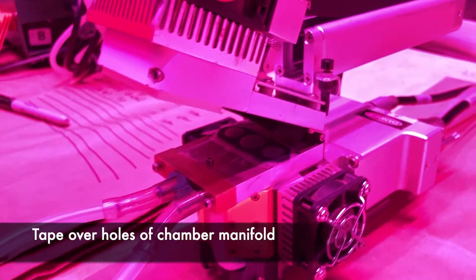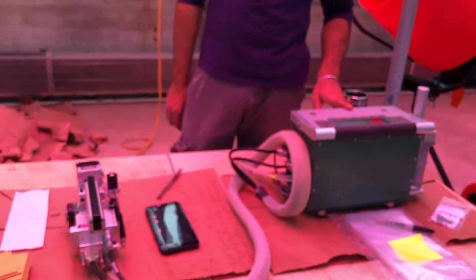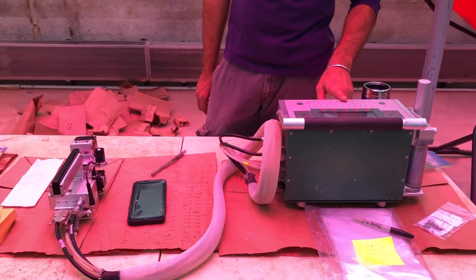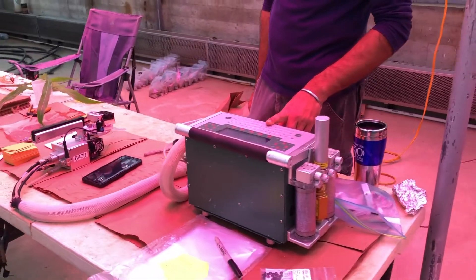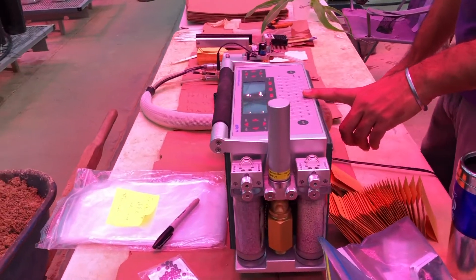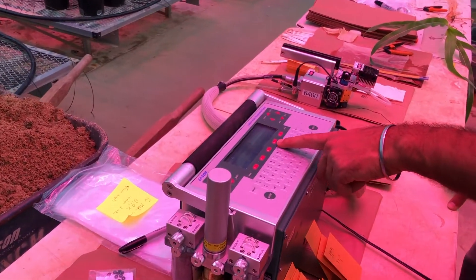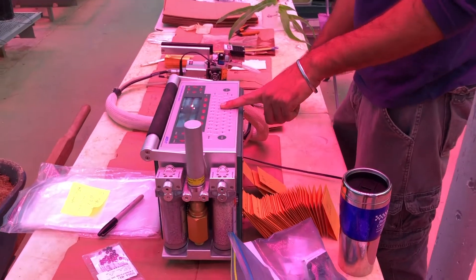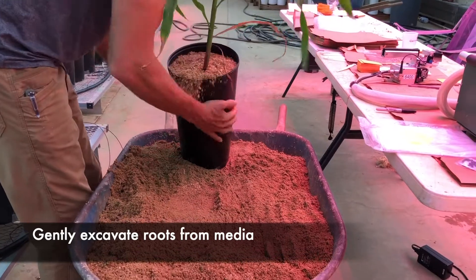Beyond the changes to the LI-COR 6400 hardware, we also need to configure the software to measure respiration and account for the volume of our respiration chamber. For our measurements of root respiration, we have configured the software to make the LI-COR 6400 act as a closed system gas analyzer, where CO2 will accumulate in the sample chamber over the course of the measurement. Our calculation of root respiration will ultimately be determined by the rate of change of CO2 concentration in the closed sample chamber over time.